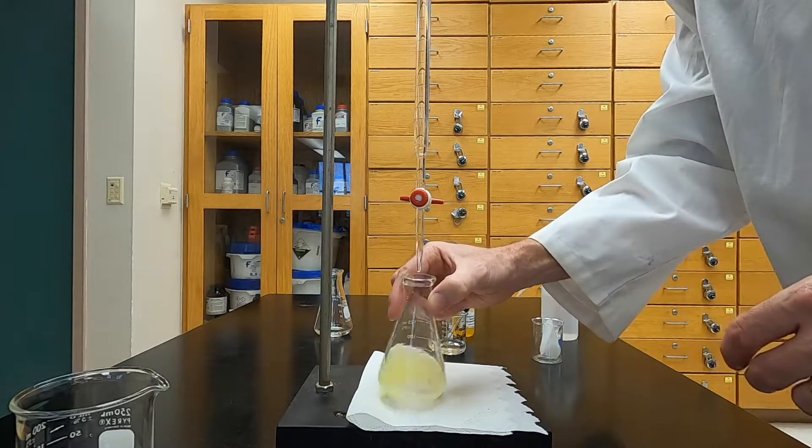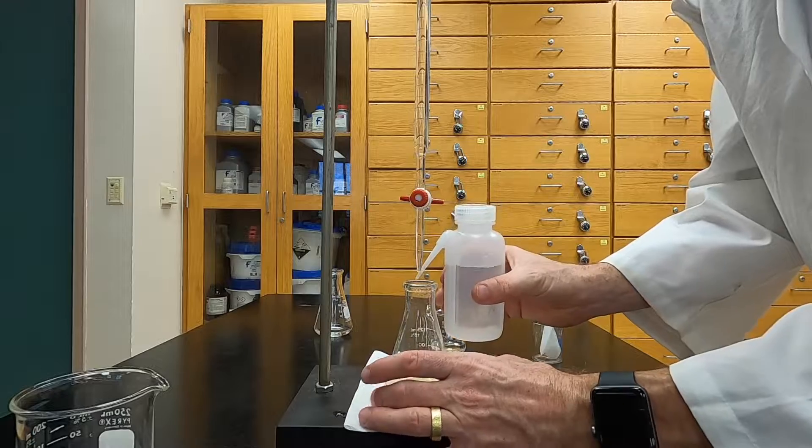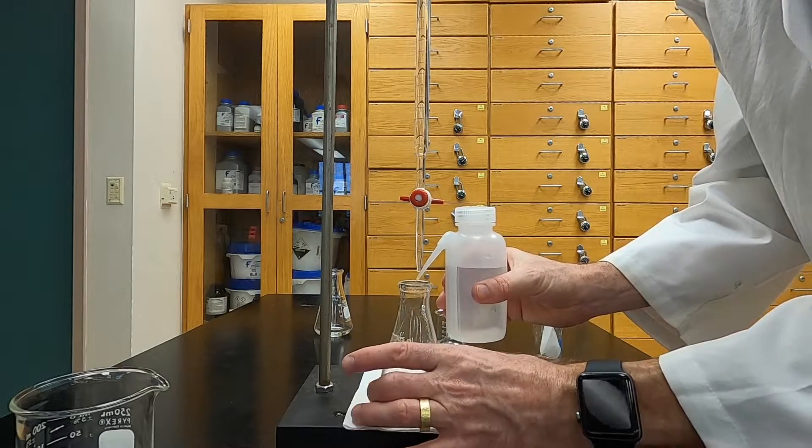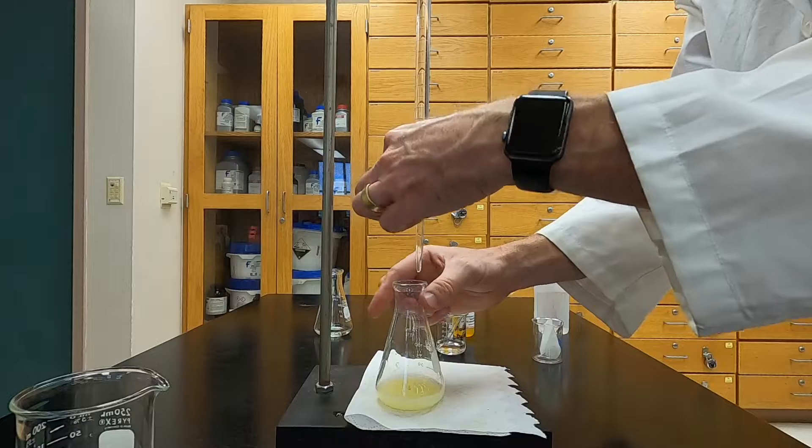As with all titrations, you'll want to read the volume on your burette before you begin your titration and then swirl the flask constantly as you're adding solution.